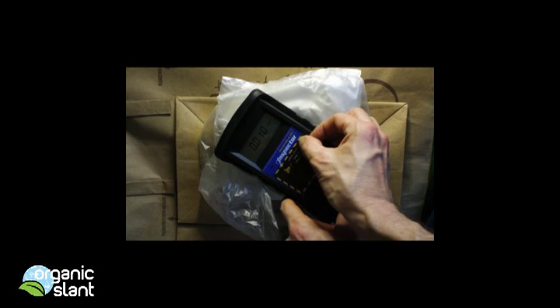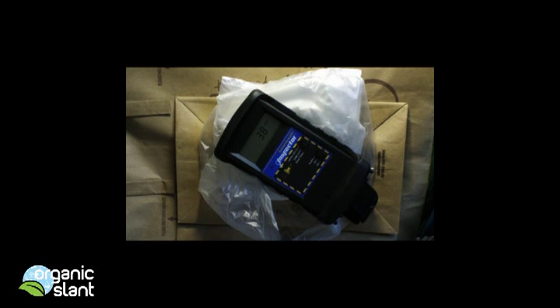I'll switch it back to counts per minute. Now I would think that if you have counts that are ranging over the hundred mark and above, then I would maybe think that it might not be safe to eat. But thirty-five, it went up to forty, really not much more than that.